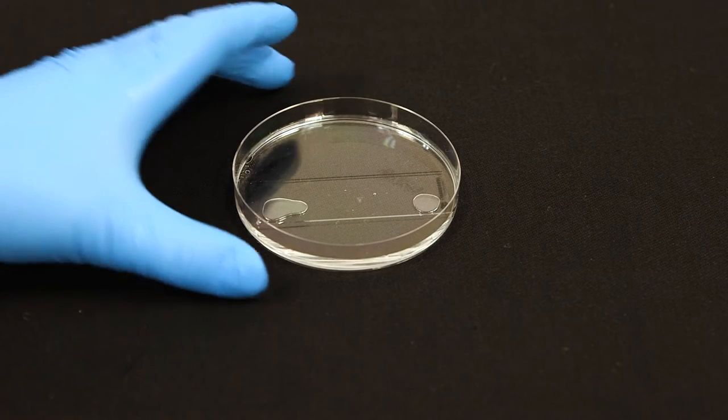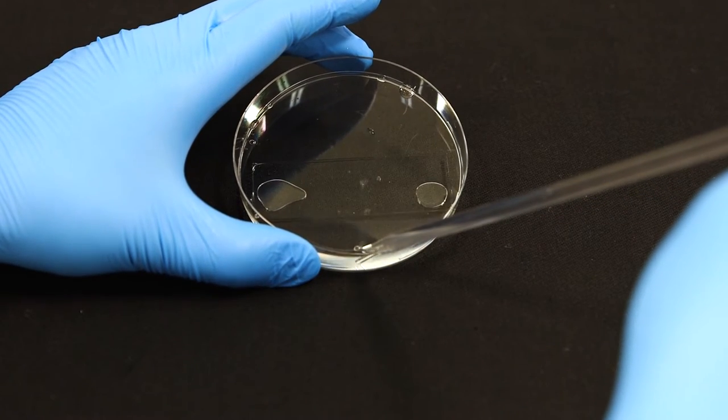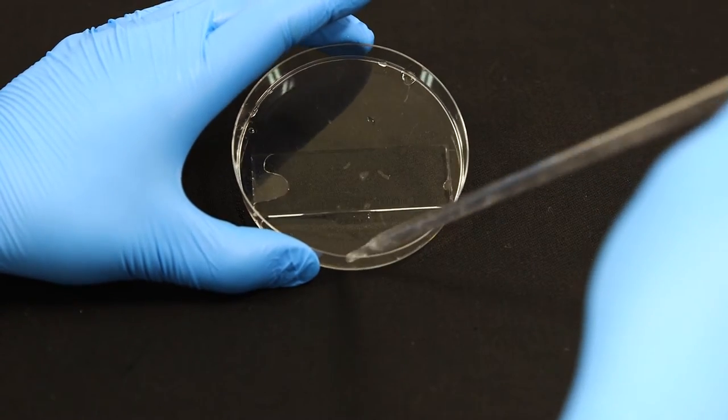After 10 minutes, tilt the dish at a 45 degree angle and aspirate the suspension buffer away. Be careful not to touch the gel with the pipette tip.